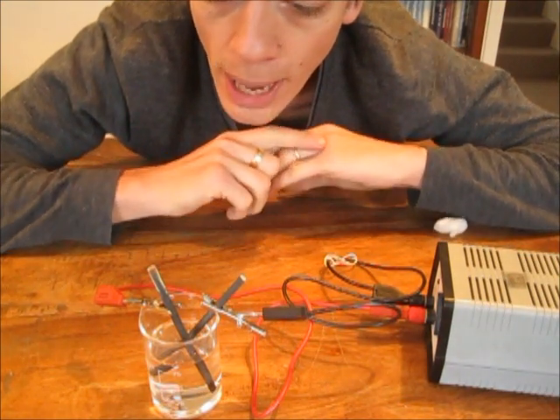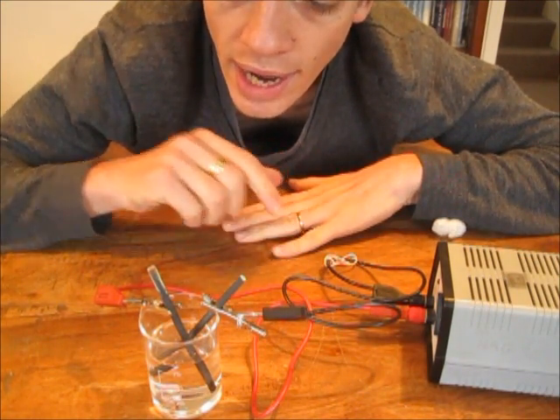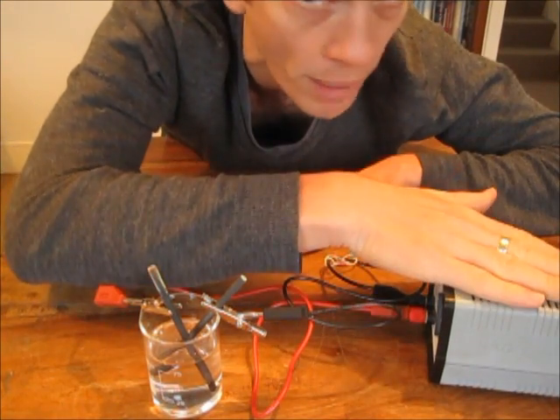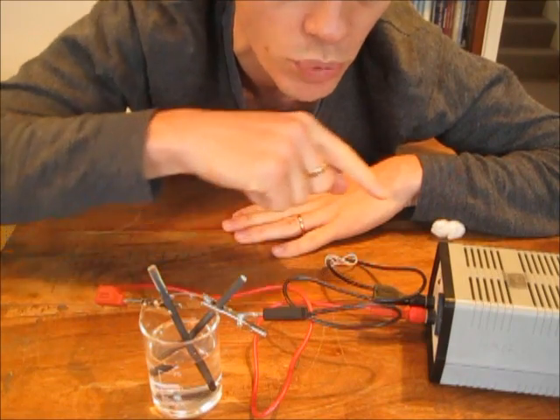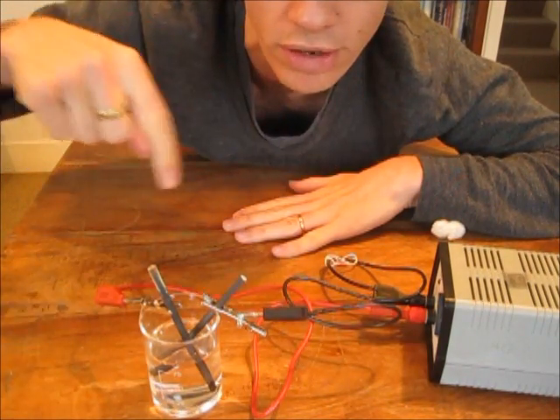Let's go through my apparatus here. I have my power pack which provides a direct current. That's a current which only flows in one direction.